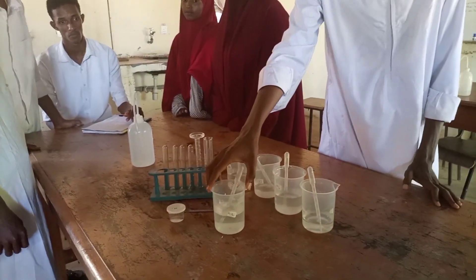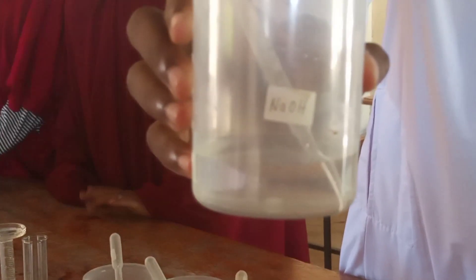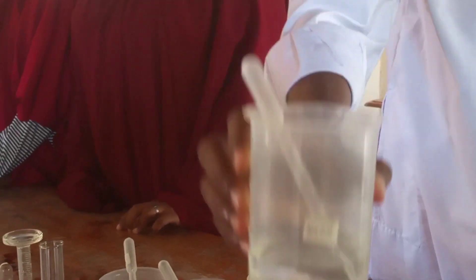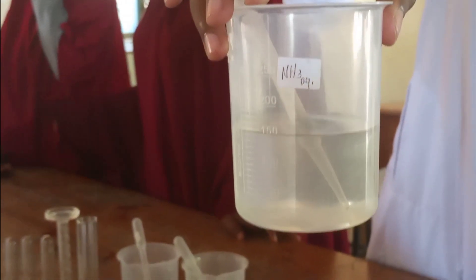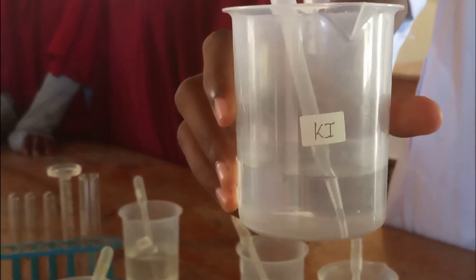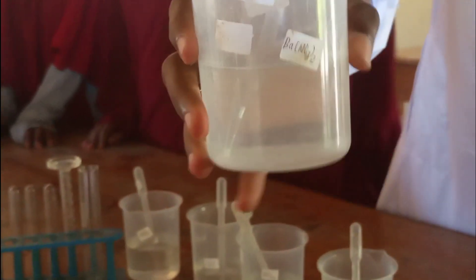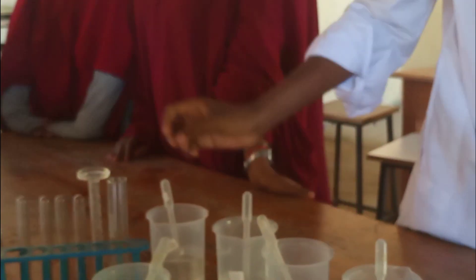We will be using the following reagents to analyze solid N. Number one: sodium hydroxide, which is a major reagent to test for cations and anions. Number two: ammonia solution. Number three: potassium iodide. Number four: acidified barium nitrate. And finally: nitric acid.